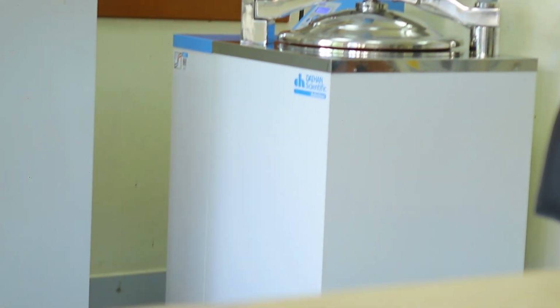The purpose of the Food Microbiology Laboratory is to verify compliance to the food safety requirements as well as the export requirements. And therefore, the whole essence of all this testing is to ensure that we support or enhance food security and also promote market access.